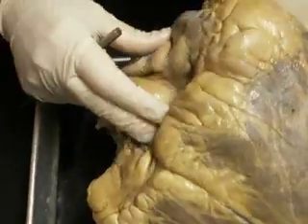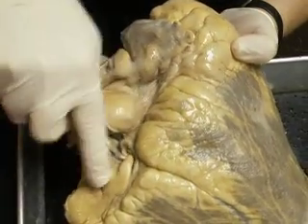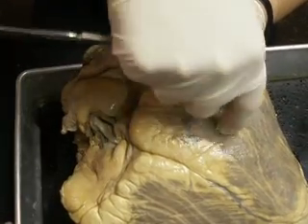And does it stick out on the other side? No. You did a neat trick with one of them. Was it the aorta that you did that trick? It goes into the groove. Coronary sinus recirculates the blood to the heart, right? Right. This is also the atrioventricular groove, which separates the atrium from the ventricle.